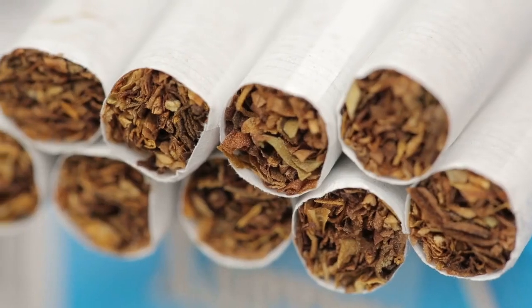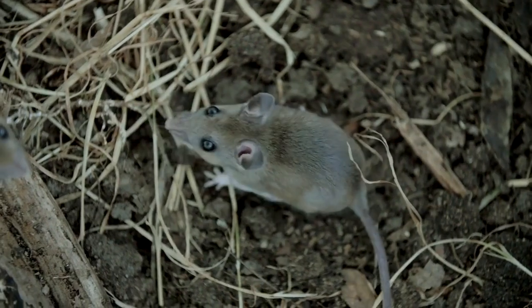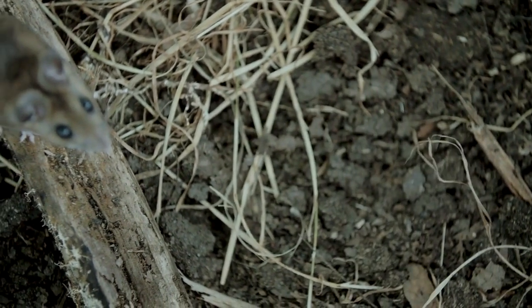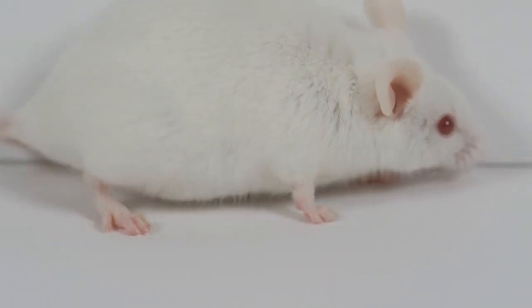The experiment continues. Now, according to the conventional way of decocting traditional Chinese medicine, decoct tobacco. Feed the cooled decoction to rats once a day for 7 consecutive days. After a week, the rats are anesthetized to death. Let's take the mucosa of the jejunum segment and detect the activity of CAD.